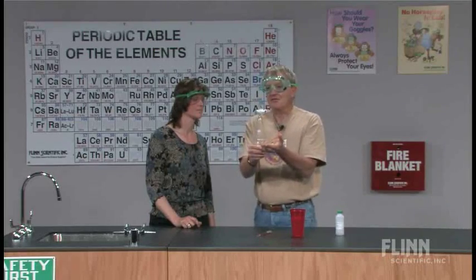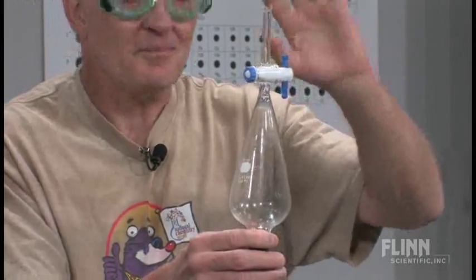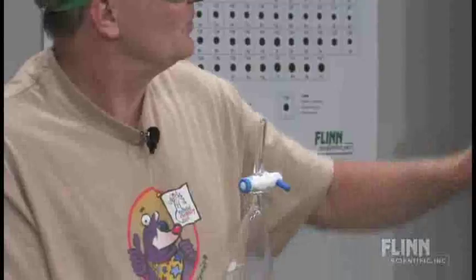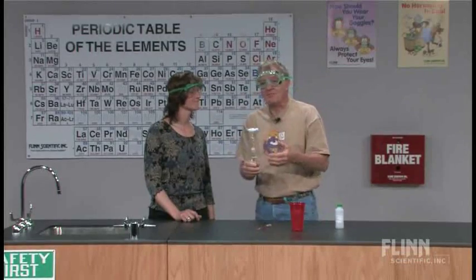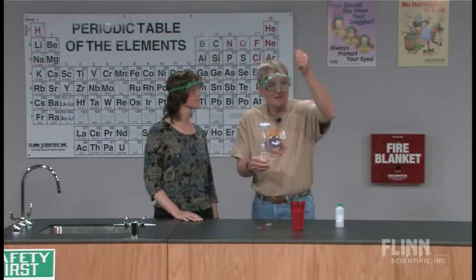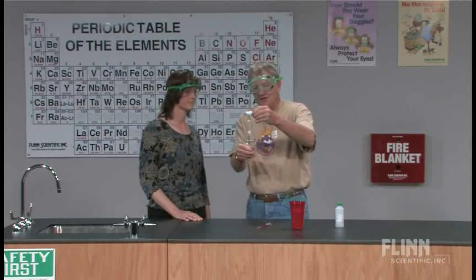So now I've established vapor pressure equilibrium, so when I open the stopcock, no sound. Pressure on the inside, pressure on the outside are the same. I've also got a student now who is an authority on any container I use in my classroom for the rest of the year. She can tell me what the pressure is, and I'll bring Sue back up 10 times during the year when we talk about pressure, and say, hey, now listen to that. Even just sitting at their seat, if I open something and they go, whoosh, hey, that pressure was greater, that pressure was less, because they know that sound, because that's kind of cool.